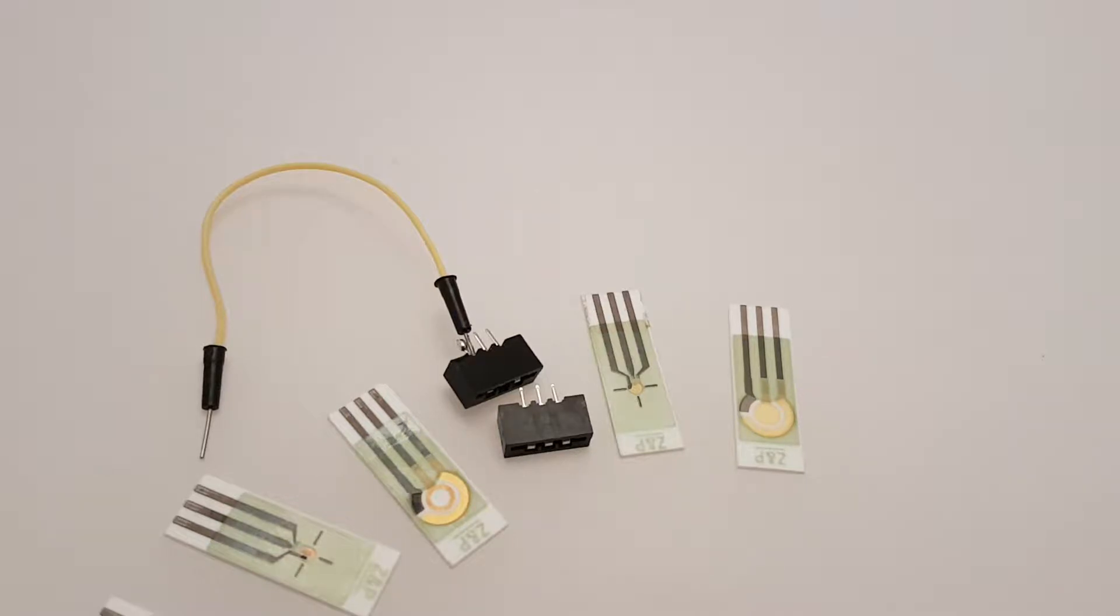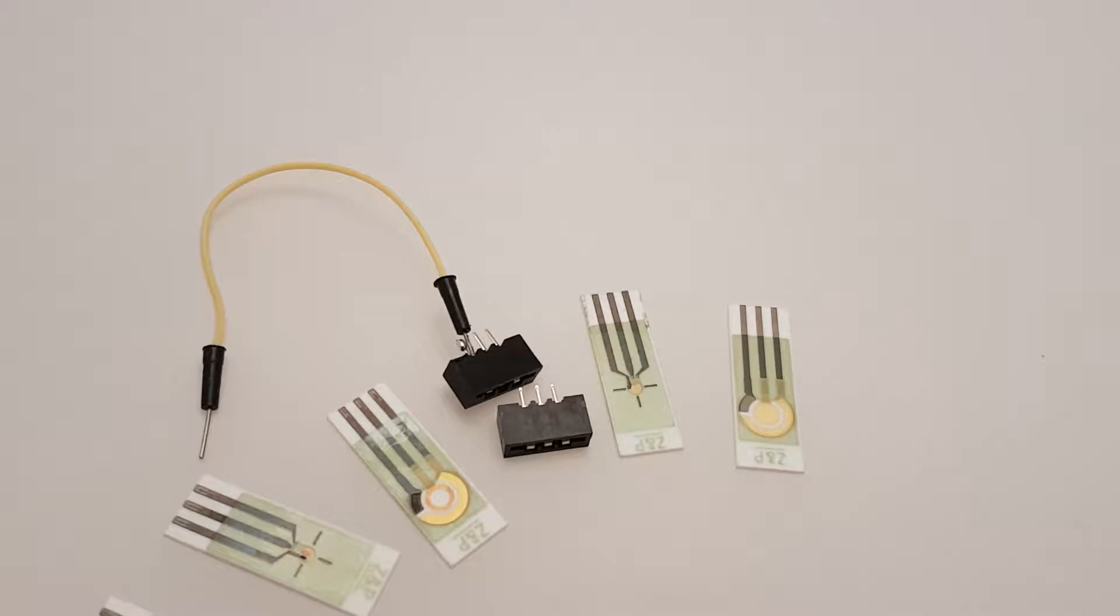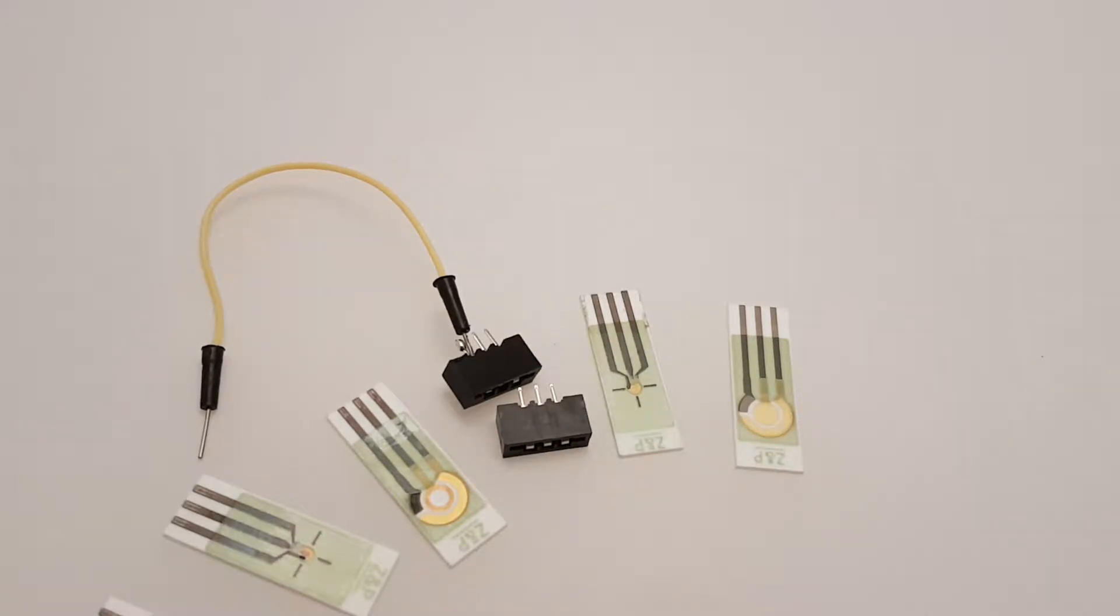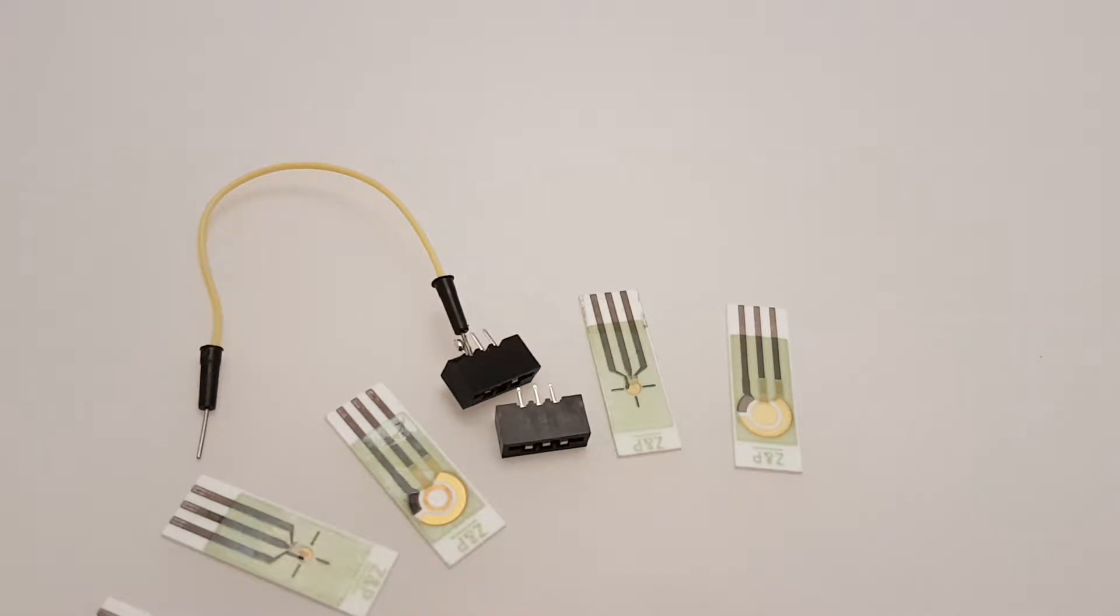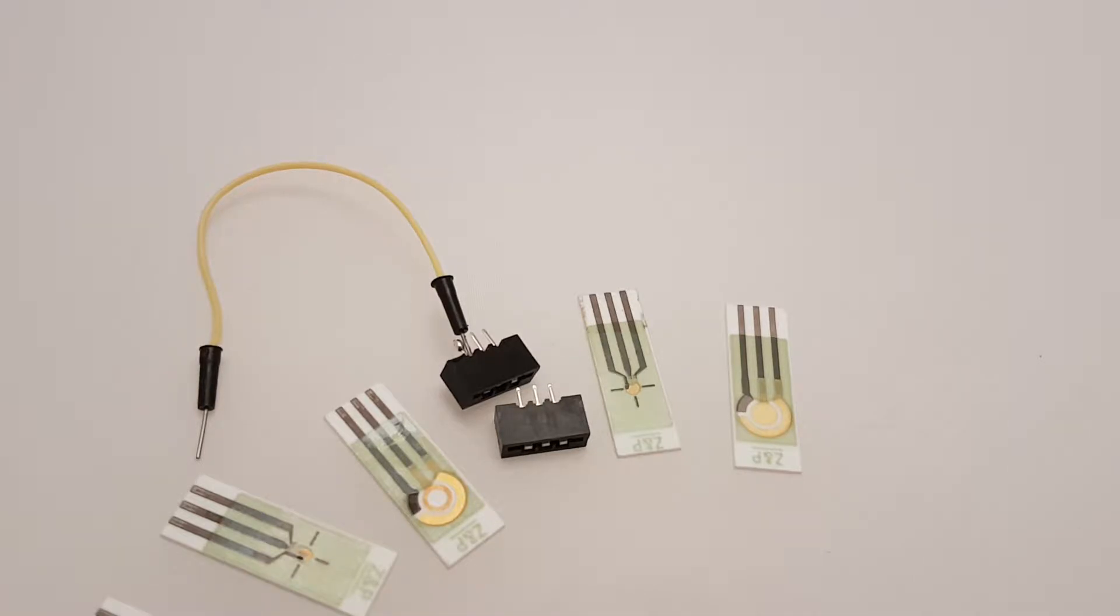Hi, this is just a quick video about how to make electrical contact with screen printed electrodes and biosensors. These particular ones I have in front of us are gold screen printed electrodes. The gold is actually put onto those sensors at 850 degrees Celsius, so they're pretty robust. I just want to talk about making an electrical contact with these things.